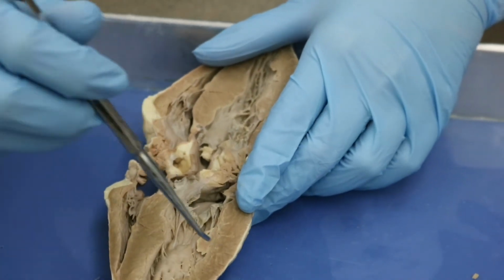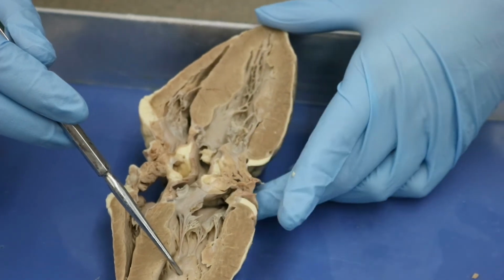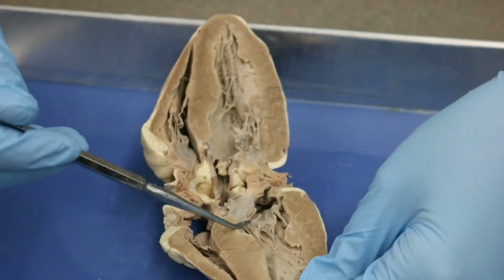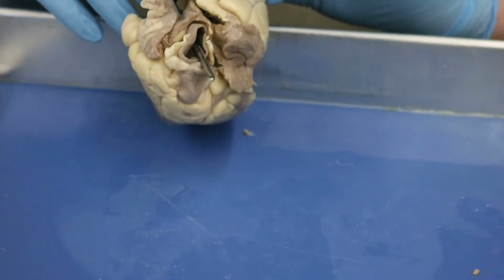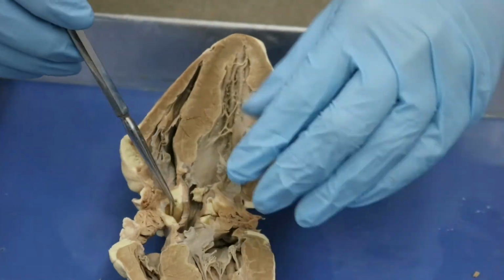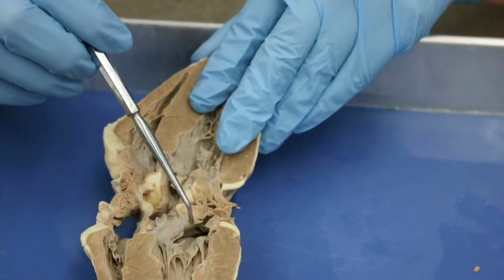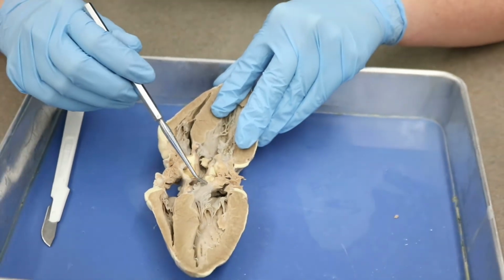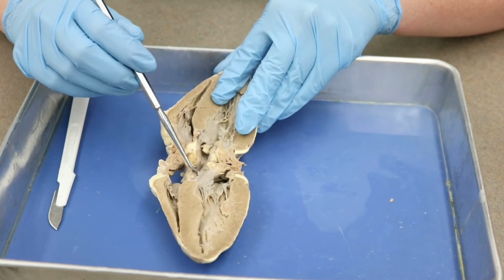Now, similarly, we would go from the left ventricle into the aorta. So let's see if we follow this, we end up coming out through what we had identified as the aorta previously. So that makes this hole here the aorta. And that means that some of this tissue here is probably the aortic valve, okay? Some of this stuff here is probably aortic valve, all right?